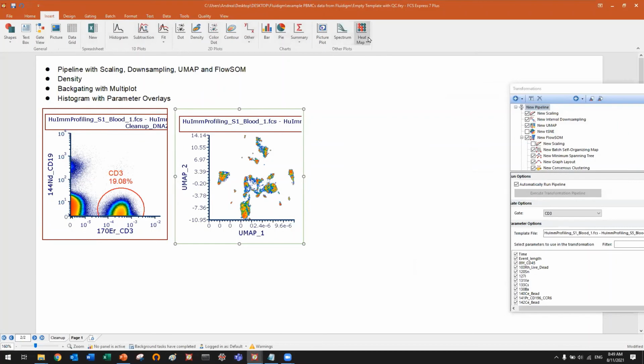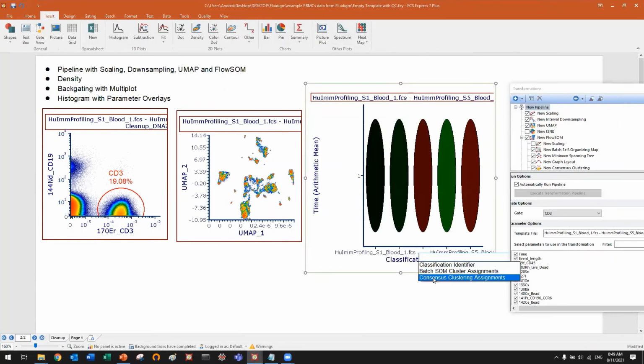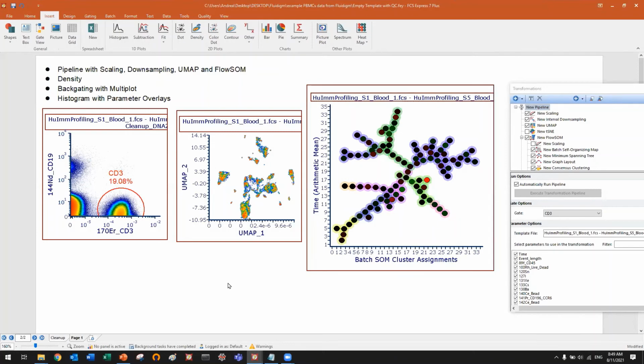Okay, insert. Let's create a UMAP plot here. Sorry, FlowSOM. Here we go. And this is live updating. You see, it takes like, I don't know, 5 seconds, 6 seconds for 20,000 events. You will probably have like 1 million. It doesn't matter. But let me tell you that FCS Express is probably the fastest on the market.